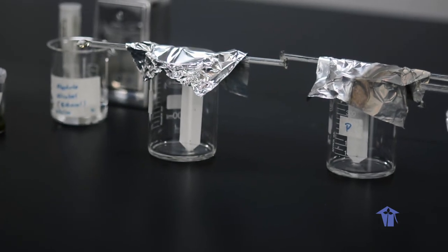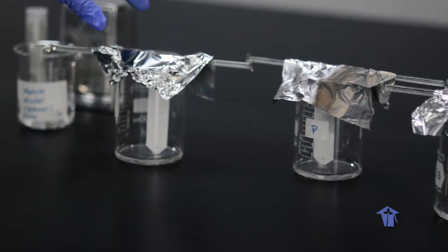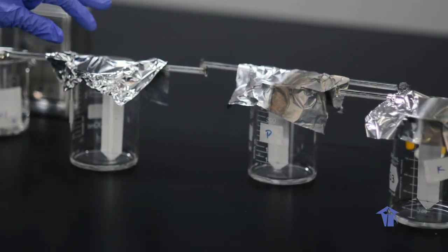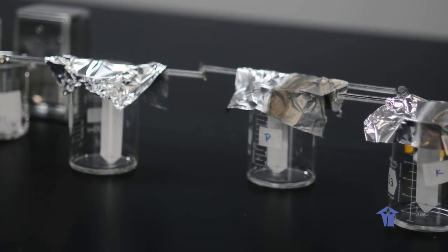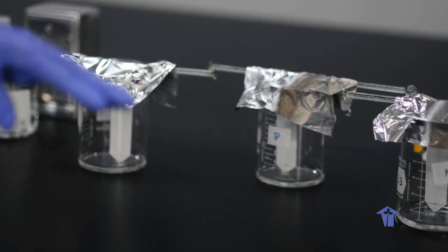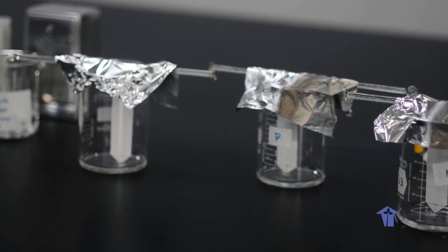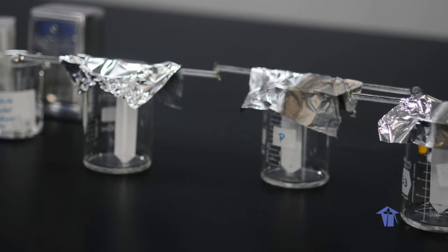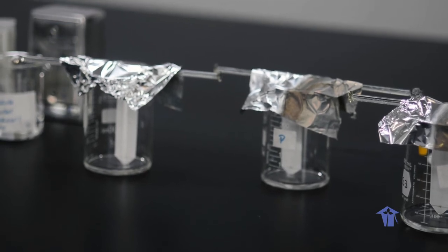In the next step, what we are going to do is to now remove the covers, remove our chromatography paper from each one of the chambers, and we are going to show what the results look like for each one of the vegetable sources that we used originally.